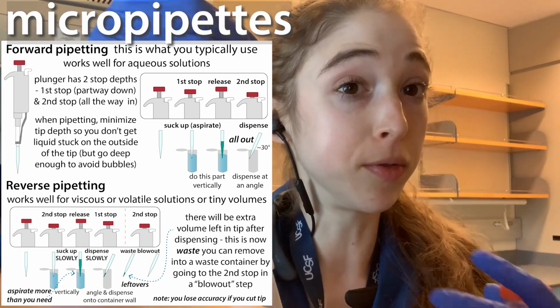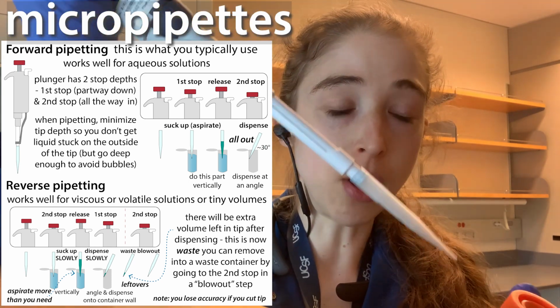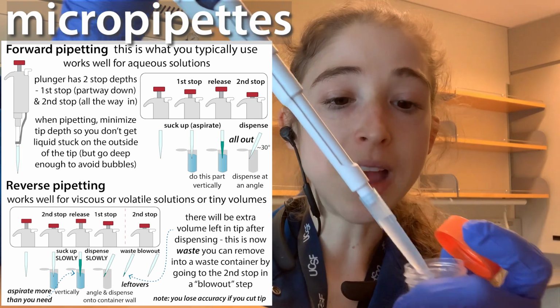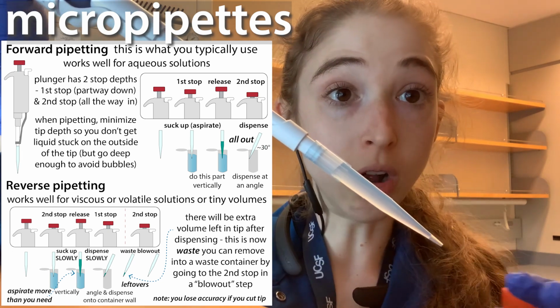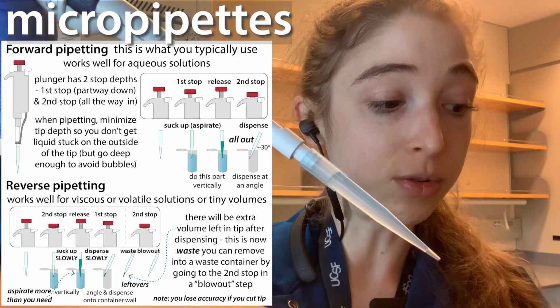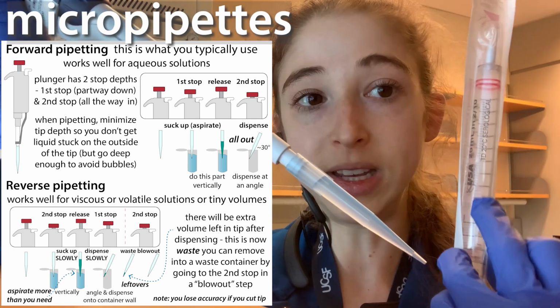There's another thing called reverse pipetting. This is where you push all the way down to the second stop, the very end, and then you draw up. Now it's going to draw up more liquid than you need to push out. When we were doing the forward pipetting, we needed to push all that liquid out, similarly to how we needed to push all the liquid out when we were using one of these serological pipettes, unless we were just going between these different lines.